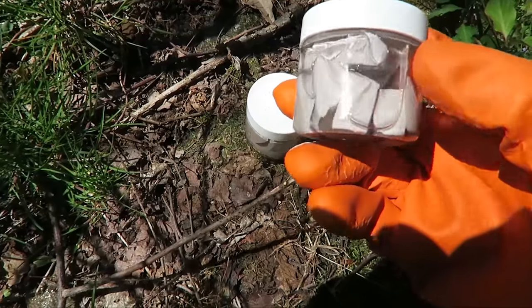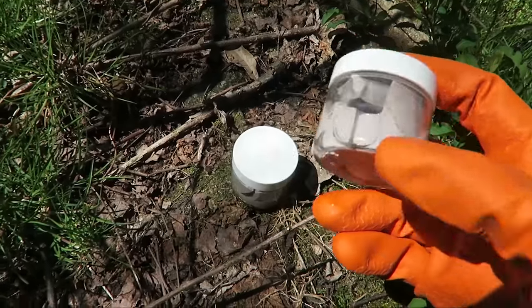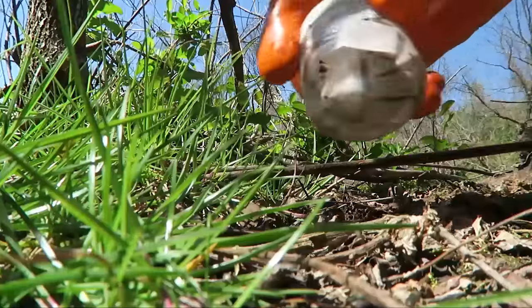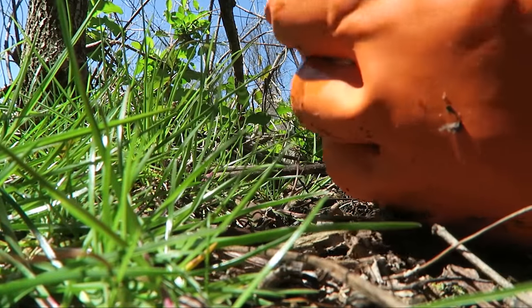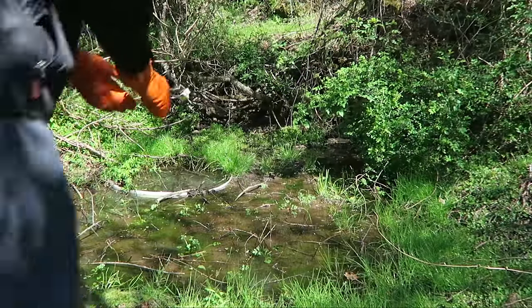I got here a lot more sodium metal and of course it's sitting in mineral oil, not water — that's why it does not explode. I've done this before with a smaller piece, so let's do this again but with a bigger piece. Okay, I got another piece — a much bigger piece. Let's see what happens.